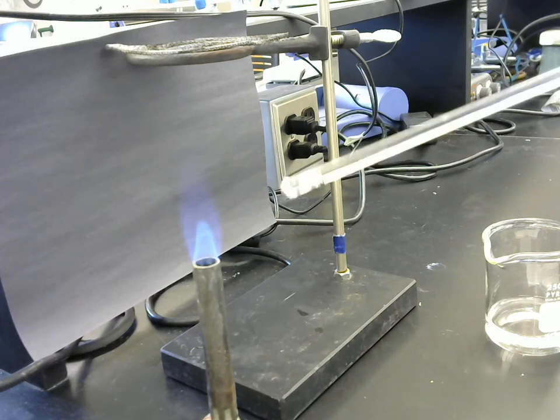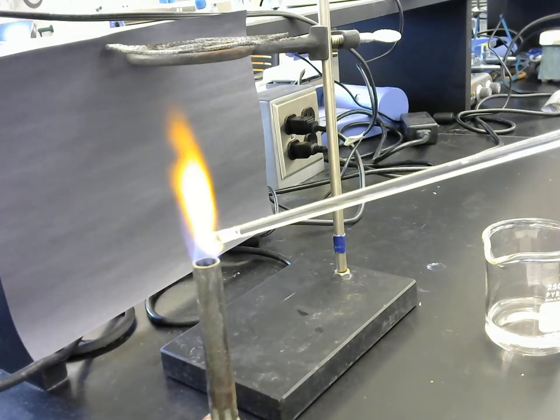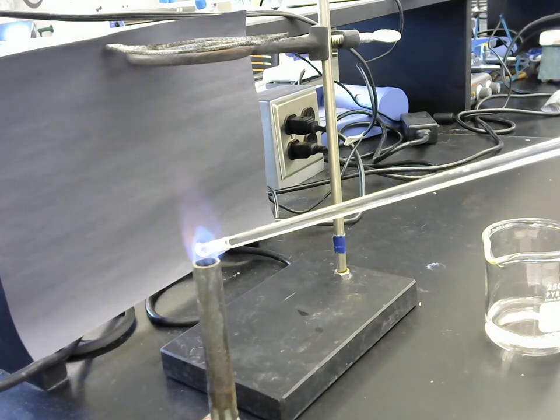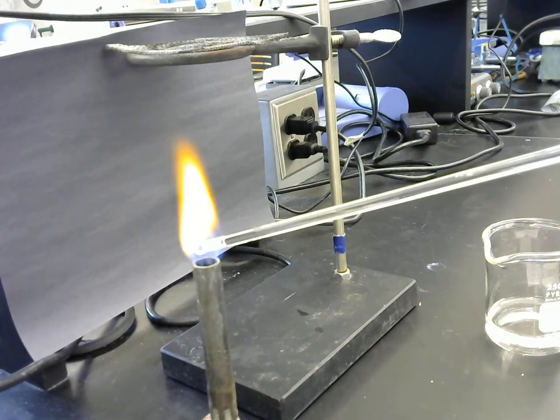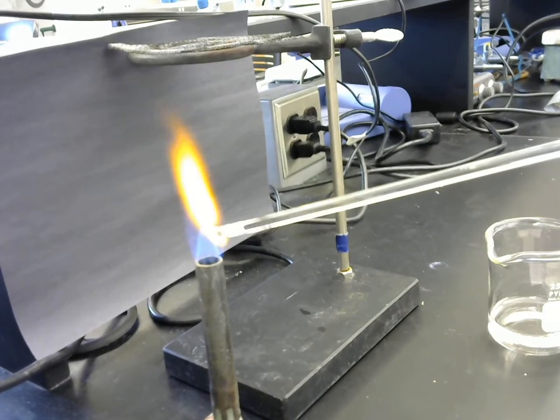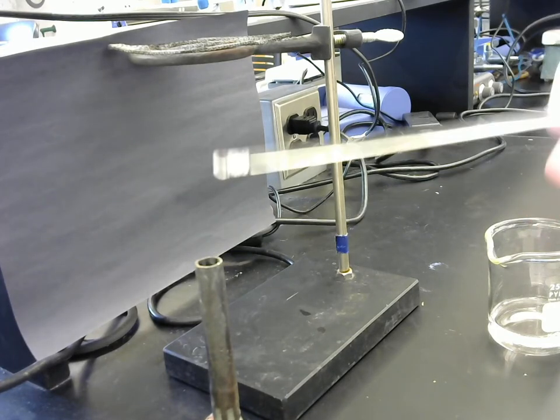Now stick it into the flame. Hey, I knew it. What do you see this time? Bright orange, like orangey yellow. Actually, yellowy orange. Okay, and we're done with the flame. Hey, it wasn't done yet. There's still more solid stuff.